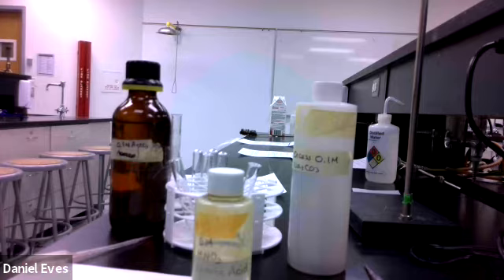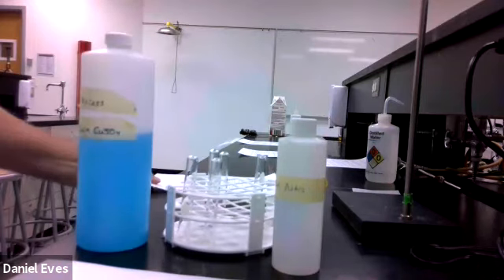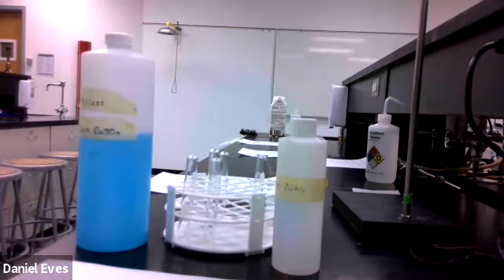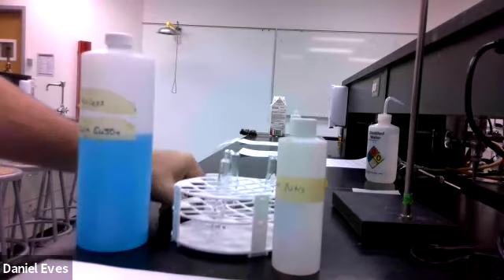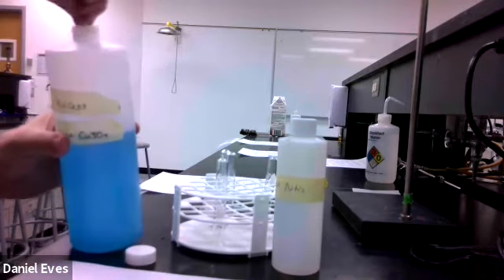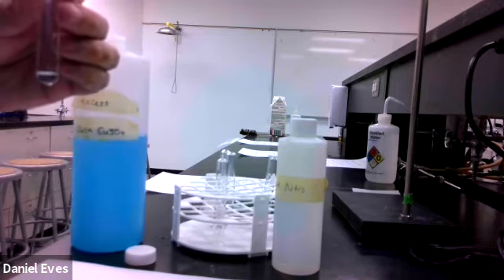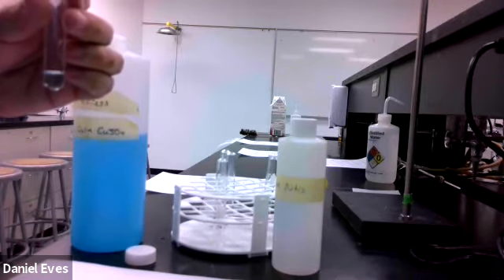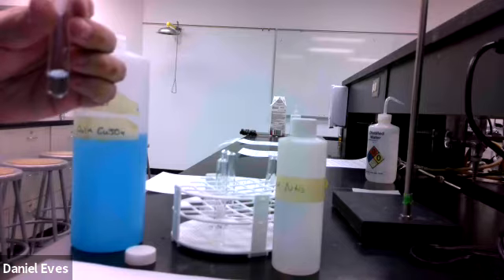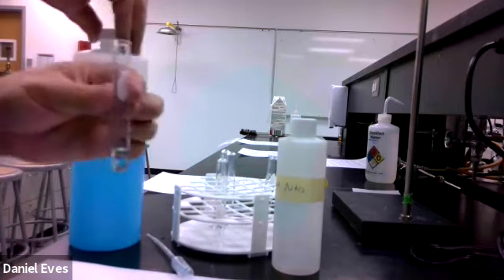We're going to set up for the next reaction, which is copper. Okay, so we're looking at copper and ammonia as we look into this. So we want to go ahead and make a compound. We want to start off with 2 milliliters of our copper solution. So we'll go ahead and get that going and get ourselves 2 milliliters of our copper solution. So right here. Okay, so there's 2 milliliters of our lovely copper sulfate, looking nice there.